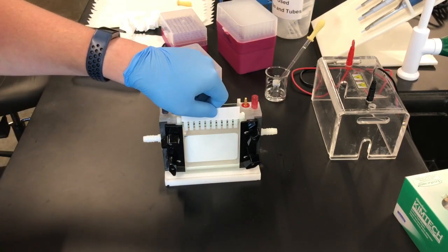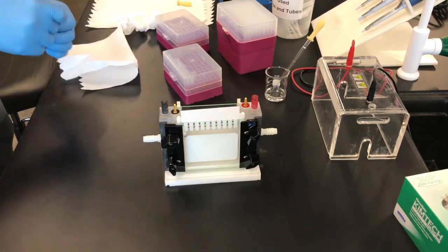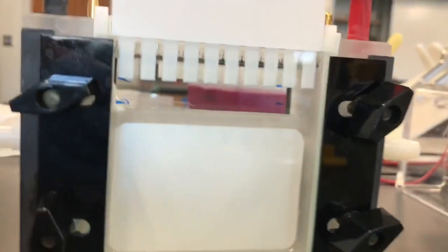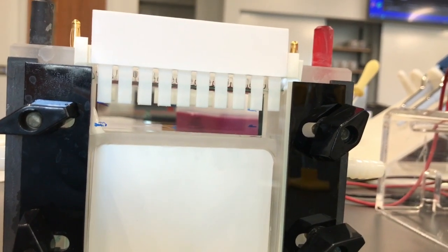Then, carefully place the comb in, making sure not to get any bubbles trapped below the comb. The comb should be placed where you drew your line originally.